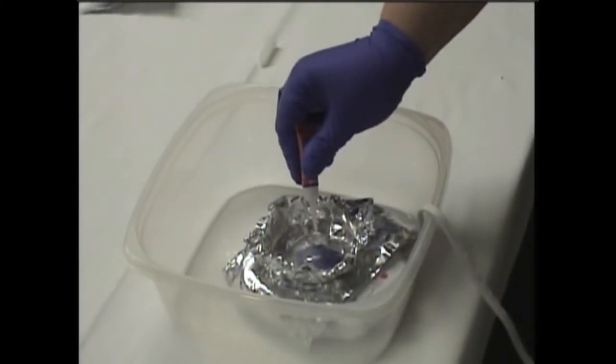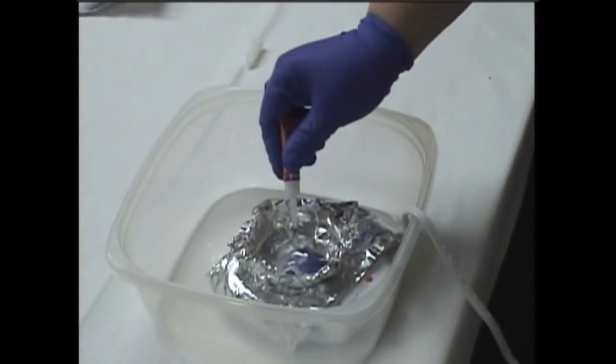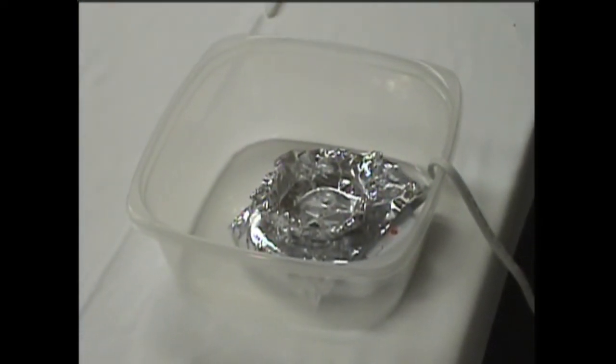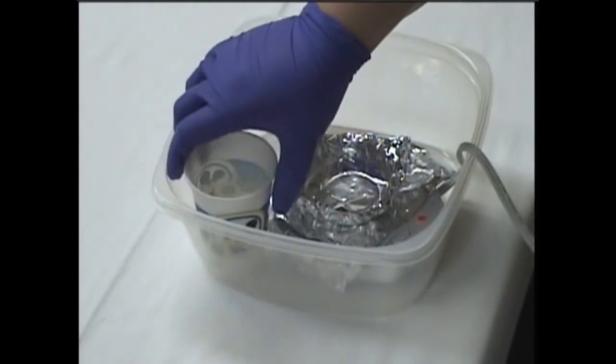Add a few drops of superglue to about the size of a nickel. Then you need to add a little cup of water to help develop the print.